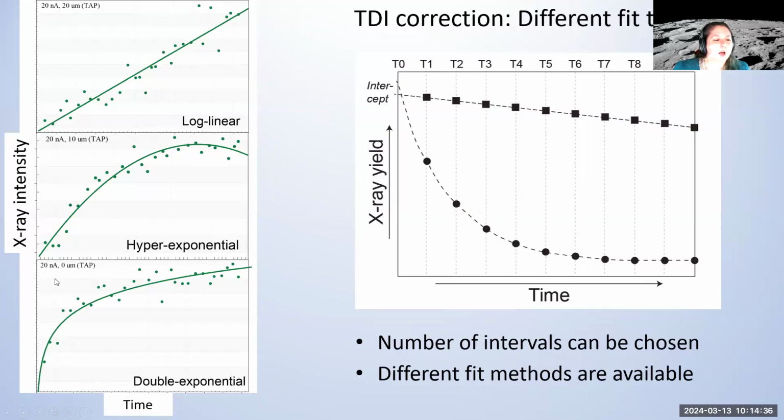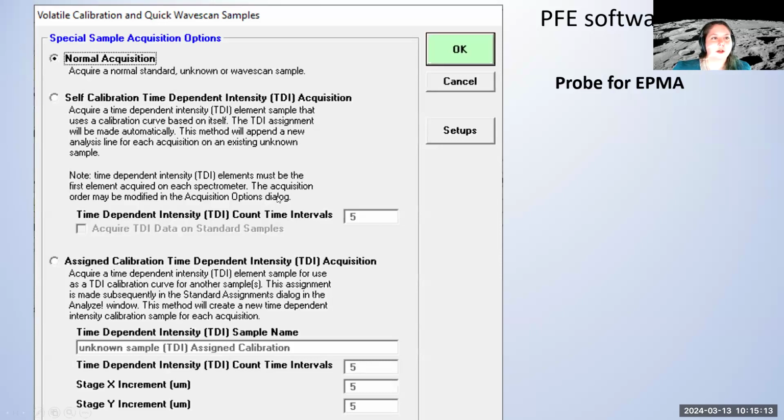So all these were acquired at 15 kV and 20 nanoamps, and I get a double exponential function for a focused beam, a hyper exponential one for a 10 micron beam, and a log linear for 20 microns. So the same material, just depending how we analyze it, can exhibit different curves. But if we can then find conditions that fit well to one of these fitting methods, we can get a really good interpolation back to zero.